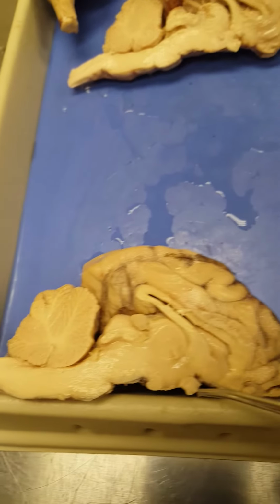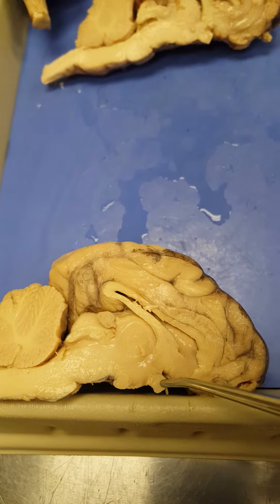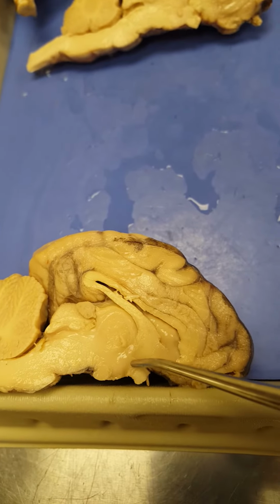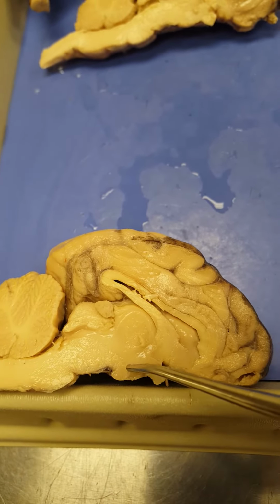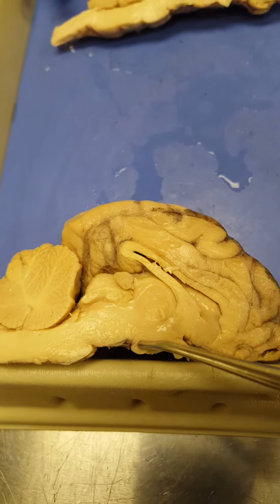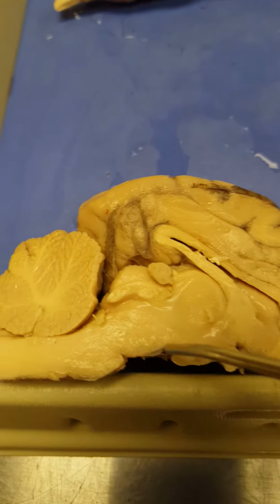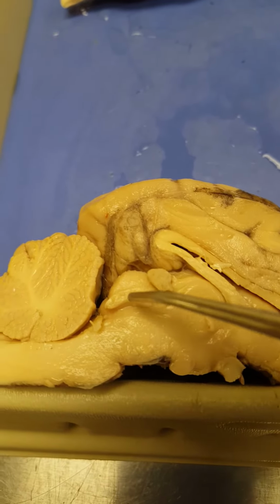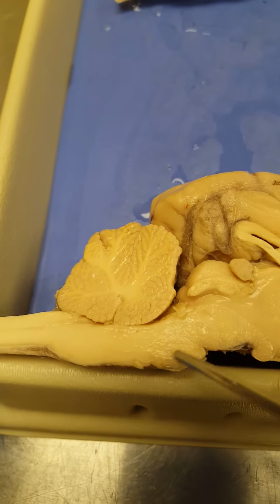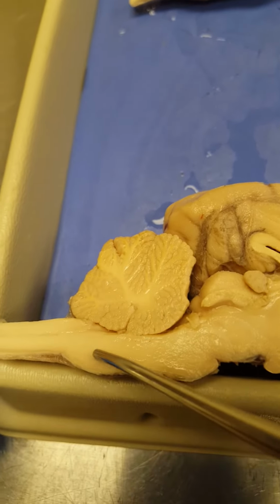And just anterior and inferior to the intermediate mass or interthalamic adhesion, we've got the optic chiasm. In between these two structures is where you're going to find your hypothalamus. And then posterior to the optic chiasm, you might see this other little white dot right here. This right here is the mammillary body. And then here we have, anterior to the corpora quadrigemina, the midbrain or mesencephalon, the pons, which is very tiny on the sheep, and then all of this down here is the medulla oblongata.